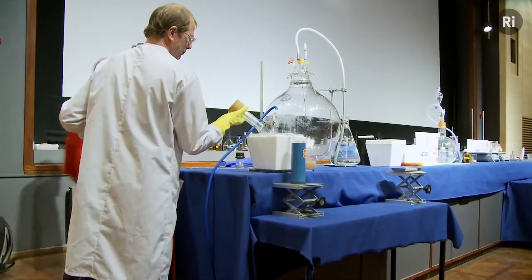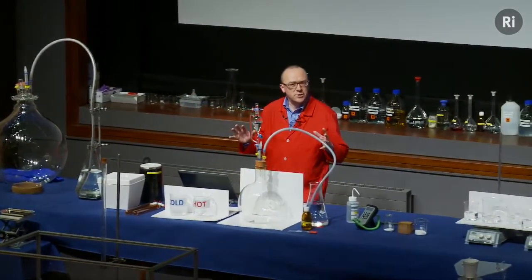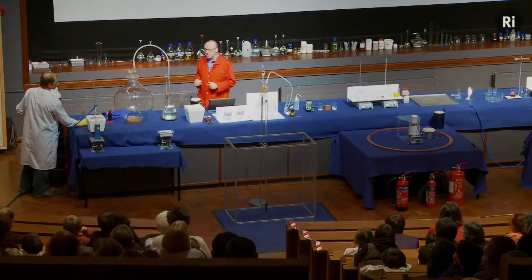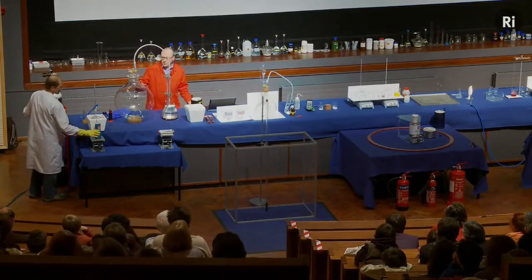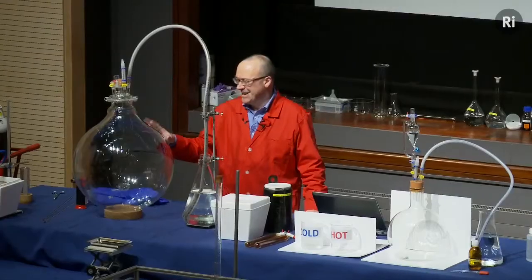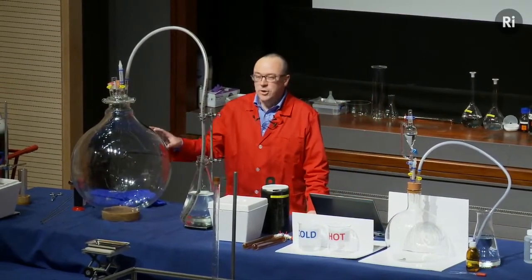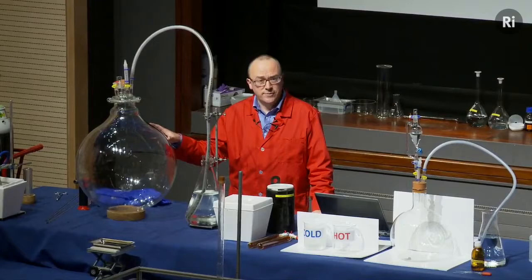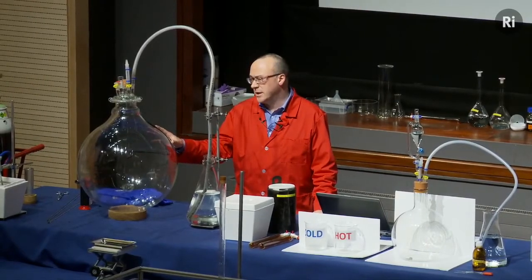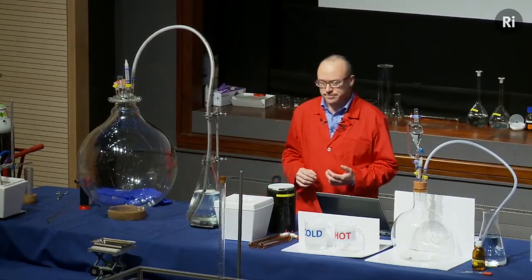So we could just burn a little bit of phosphorus on the bench, but we thought what we'd do is to scale this up and do this on the largest scale we could. And so this is actually the largest flask that you can buy in the UK. And so this is about as big as we can make it. And we're going to burn quite a big chunk of white phosphorus inside this flask. And to make it burn really well, we're going to fill the flask with pure oxygen.